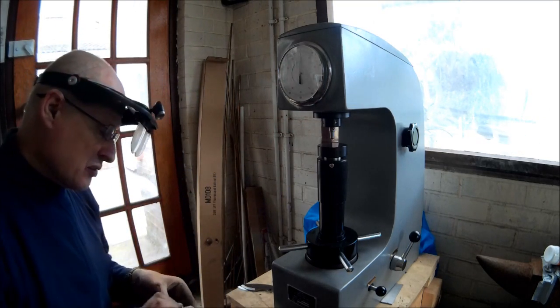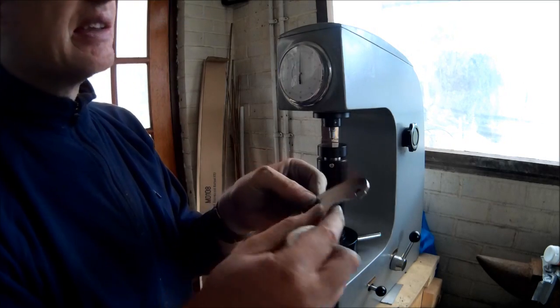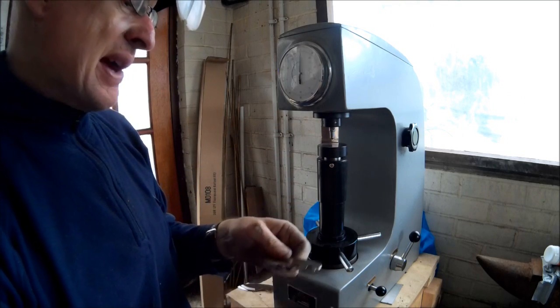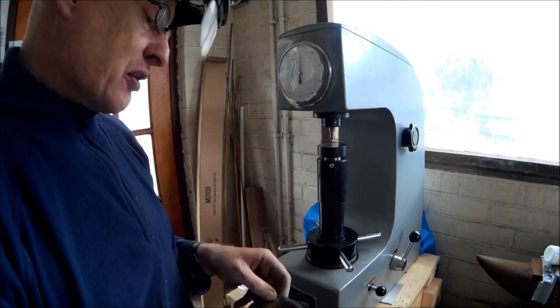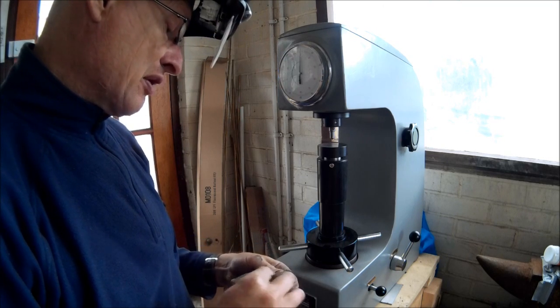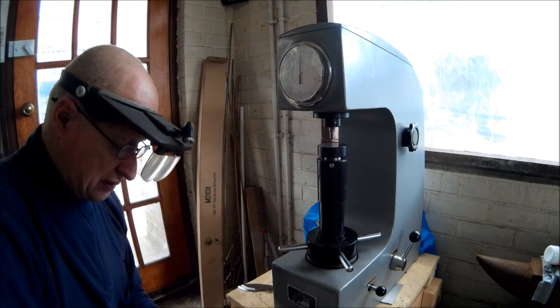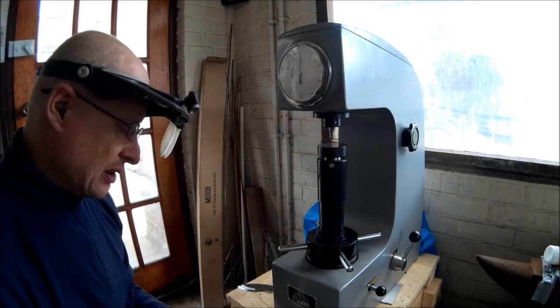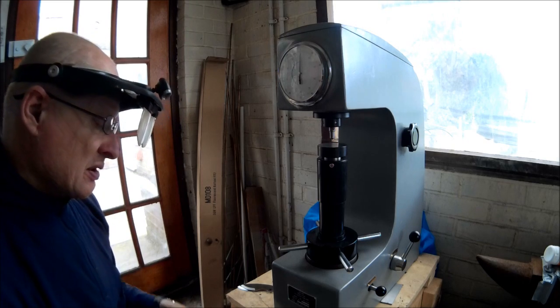Make sure the test piece is as clean as you can get it. One of the fatal errors I was getting in the past was debris in the lanyard holes — I'd put the piece on here, manipulate it, and bits of debris would fall out and get compressed underneath the test piece during the testing cycle, giving me erroneous readings. I was getting all sorts of problems thinking I'd made mistakes, but it was just a little bit of dirt throwing the readings out. Also, you want your blades to be as flat as possible — any warping or gap underneath the piece when you apply the test load will give you a false reading.